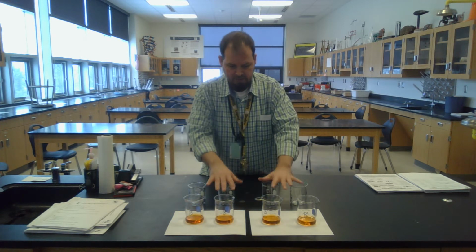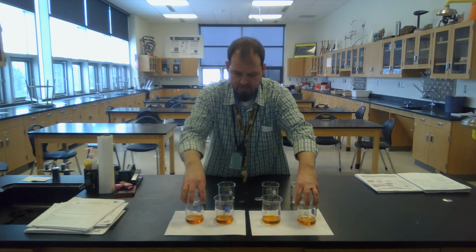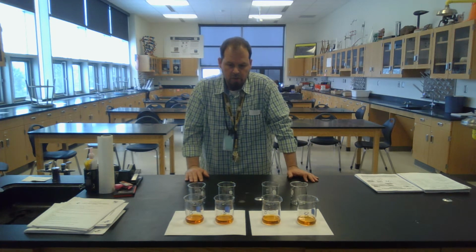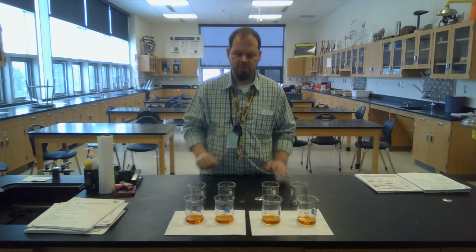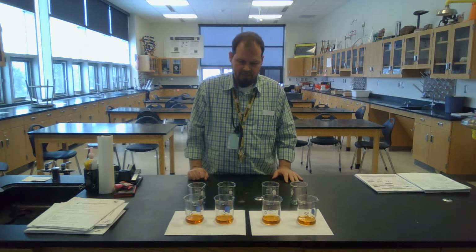I have equal amounts of liquid when I put them in. So I had 20 mils here and 20 mils here to make 40. I'm going to probably give you guys Erlenmeyers so that they're tapered and the solution will be a little bit higher up. And that way you can see it change a little bit better. I don't know if it'll be harder to pour than this was, but I'm sure we can make that work out pretty well.